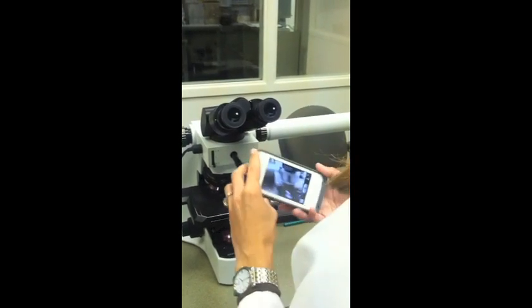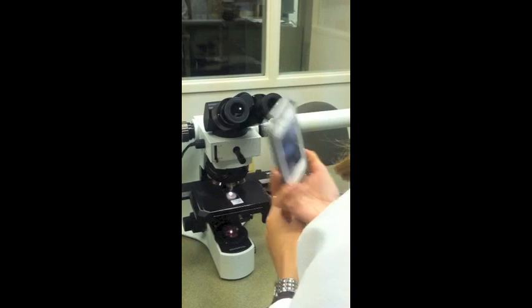In this video, we're going to talk about using a basic smartphone to take pictures through the microscope.